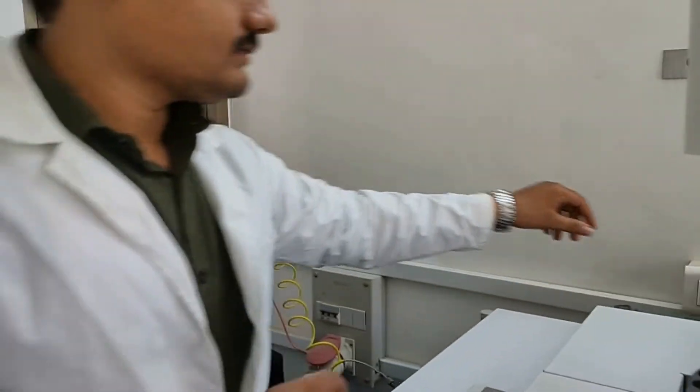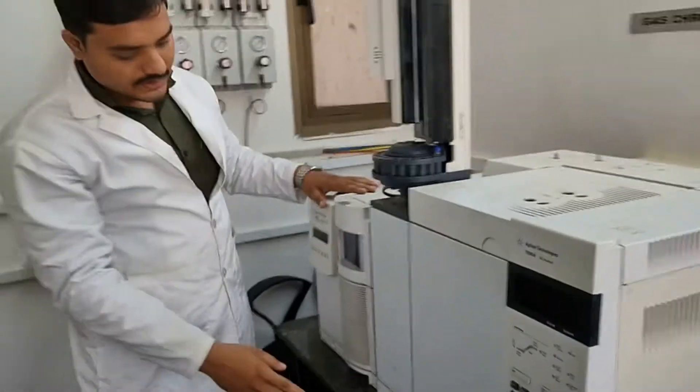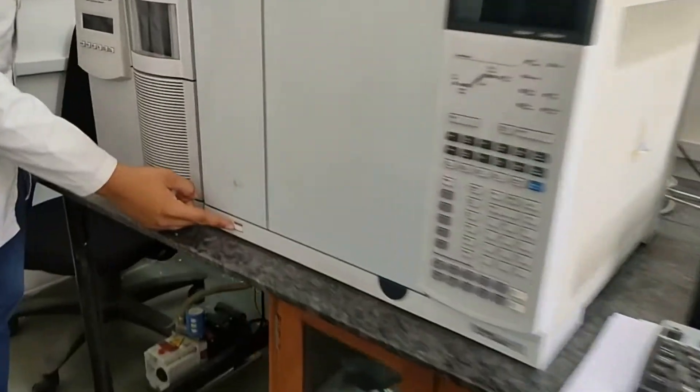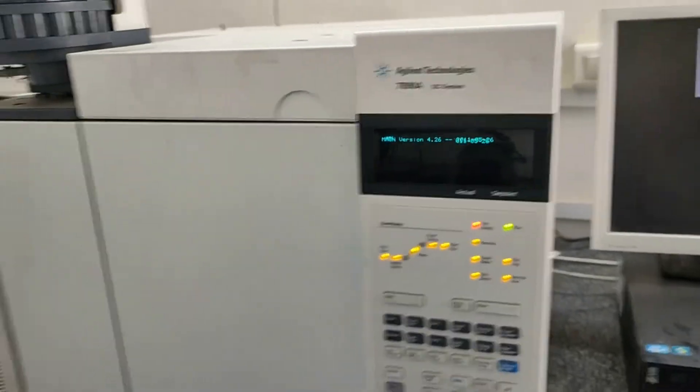Switch on the instrument. Now you can see here, the instrument is switching. Our instrument is starting up.